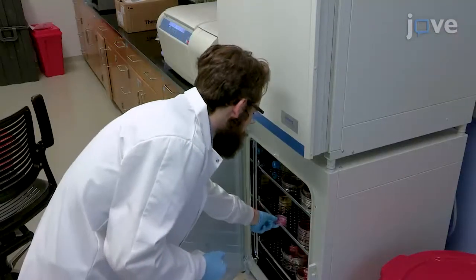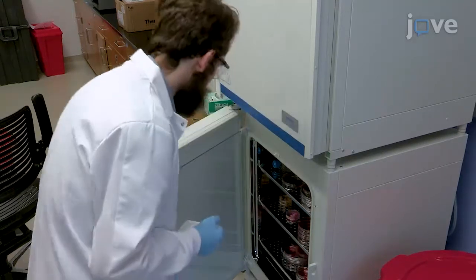The specificity of this technique allows for gentler chemical washes to better preserve tissue properties. Breast cancer relapse occurs following therapy, especially in triple-negative cases. Evaluating how the irradiated extracellular matrix alters tumor cell behavior will lead to important discoveries about recurrence mechanisms.